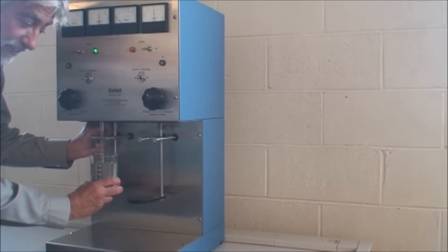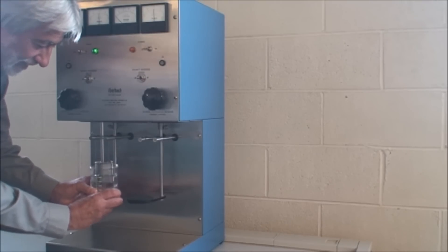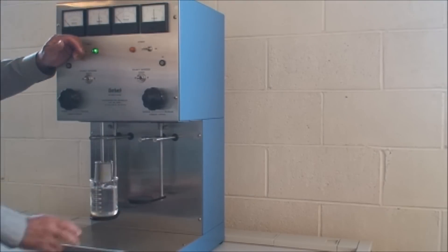Since the power is on, carefully lower your beaker without touching the electrodes, and then you can shut off power.